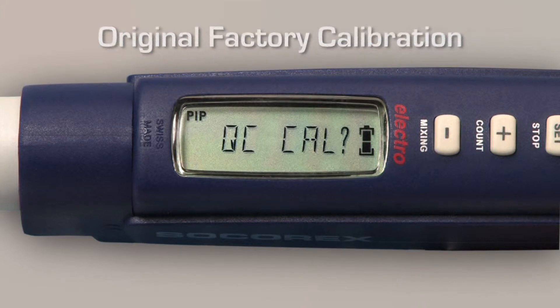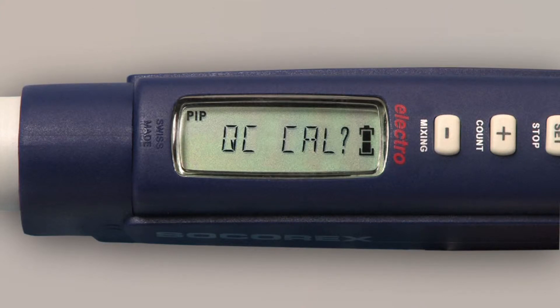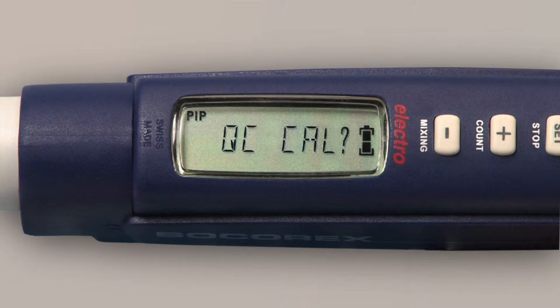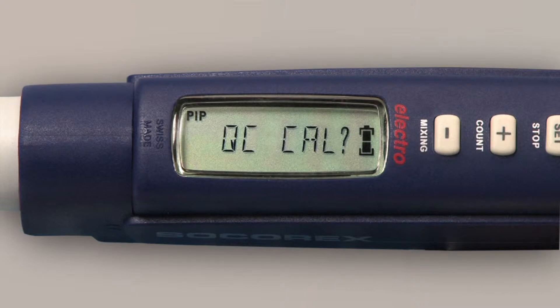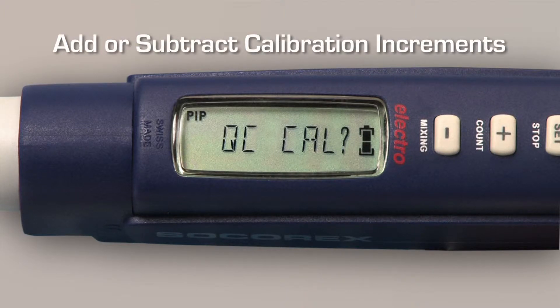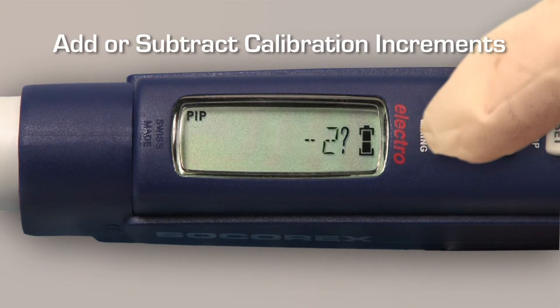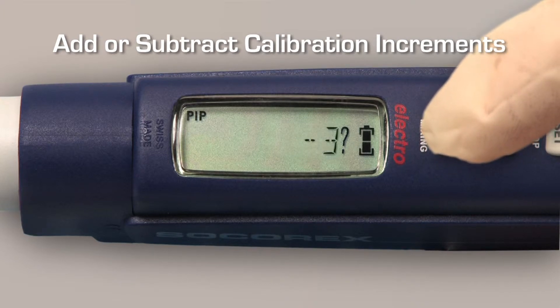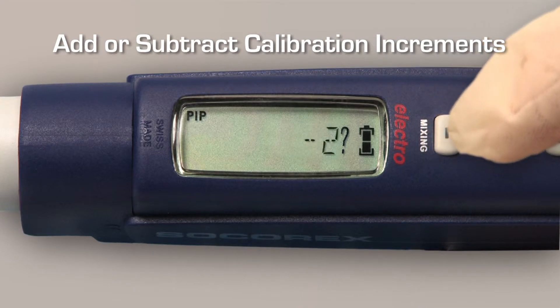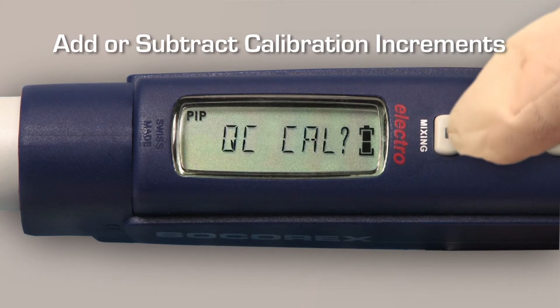Other volumetric modules purchased as accessories will display zero as the target calibration value. Calibration is performed by increasing or decreasing the calibration increments according to the values given in the operating instructions, to the calibration value indicated on the display.